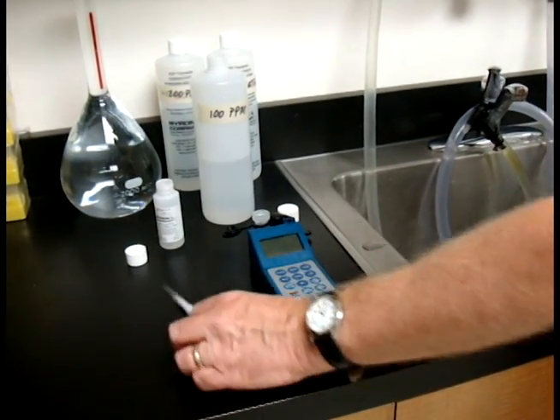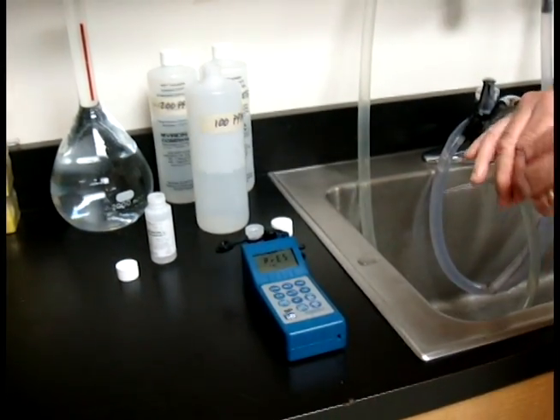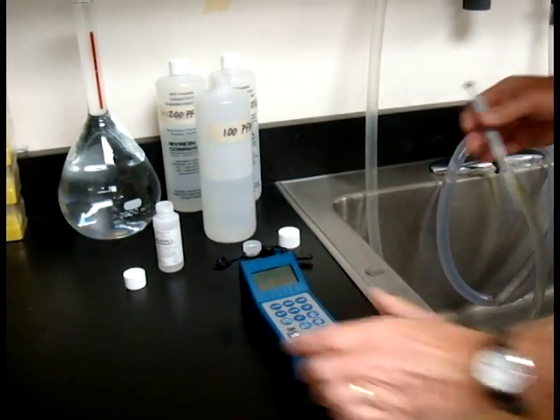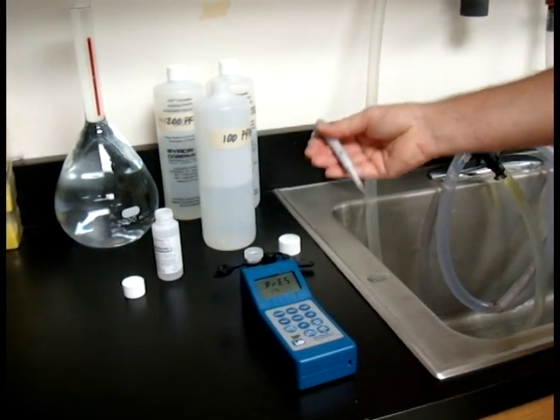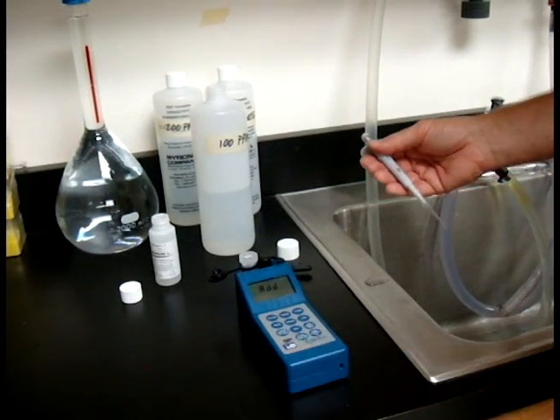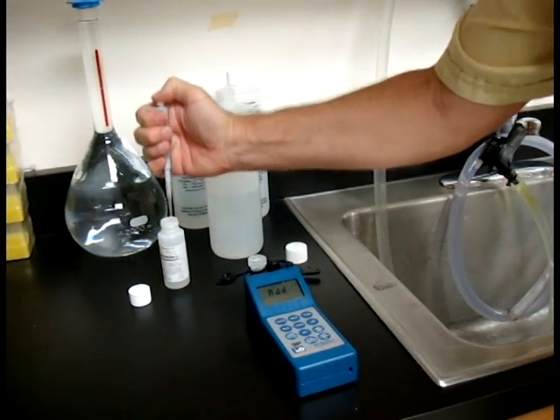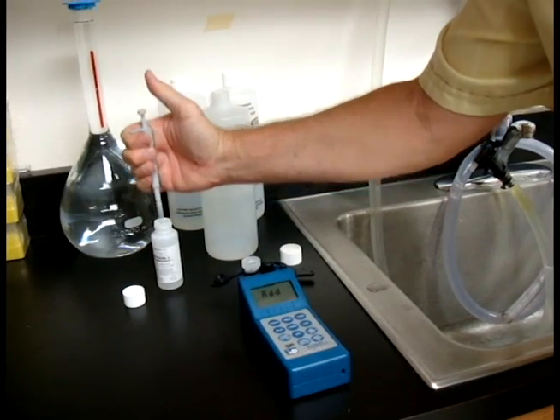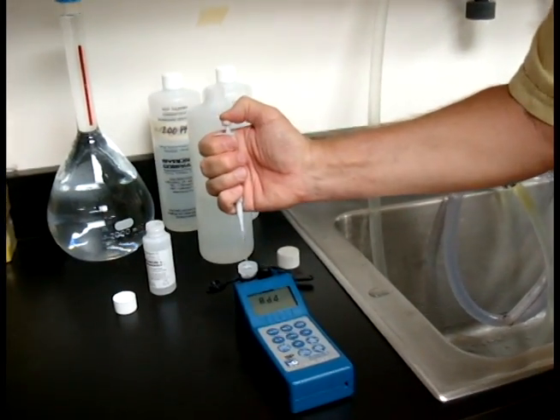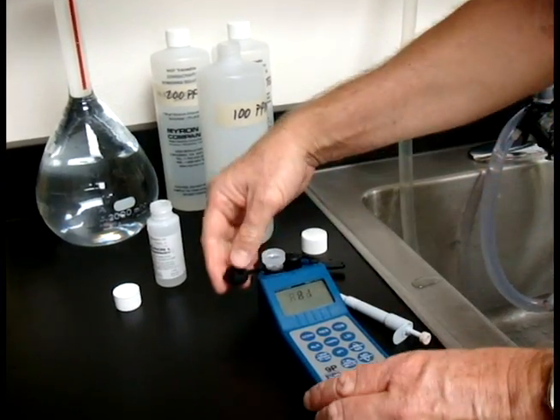To begin, hit your alkalinity button. And it says press CAL. I like to get my pipette ready, and then we'll hit CAL, because it's going to ask me to get some A1. Get some A1 reagent. Put that in your cell cup. Put your cap on.